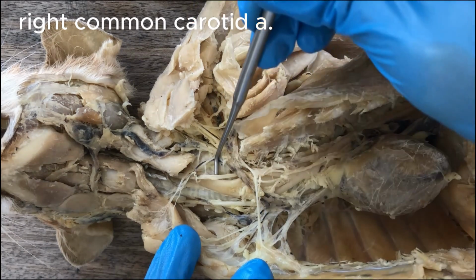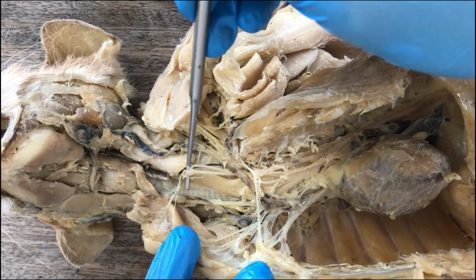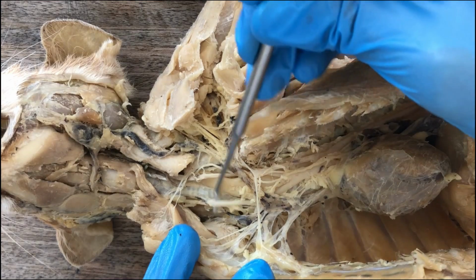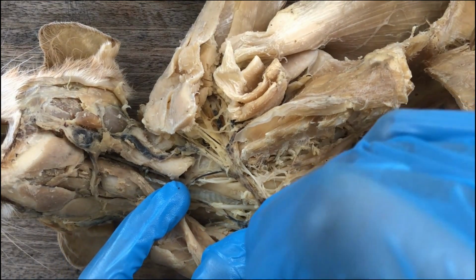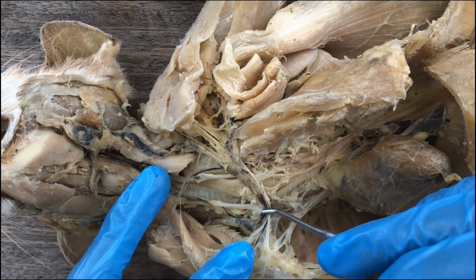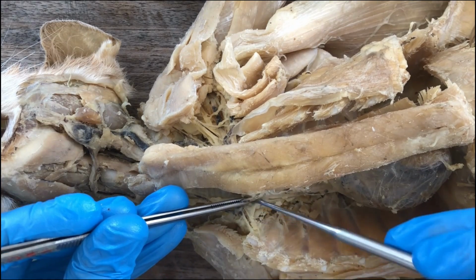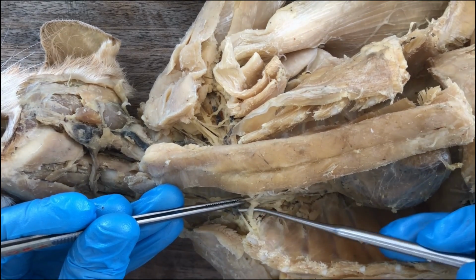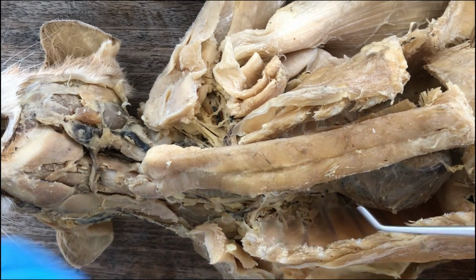So the left common carotid artery came out first, and then later the right common carotid artery, and then whatever remains of the brachiocephalic will be the right subclavian artery, which, just like the left counterpart, will give rise to the branches supplying the forelimb.